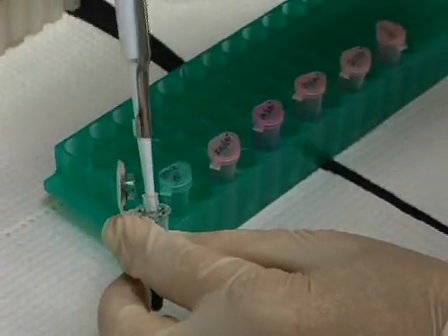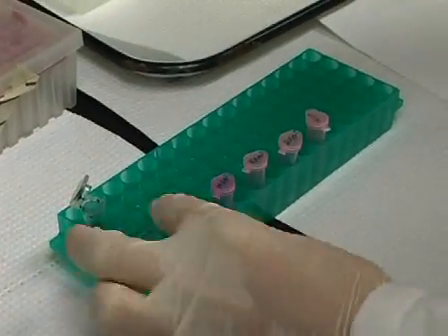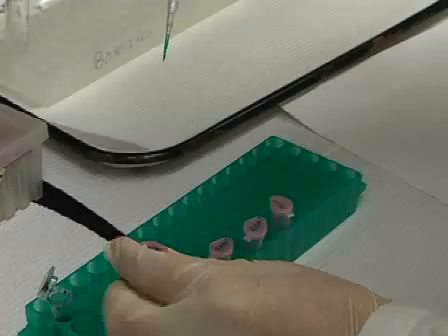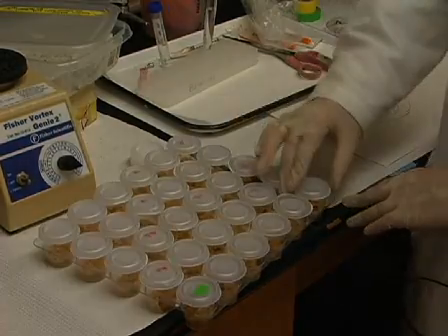Include green food coloring dye to a 4% concentration by volume. In order to determine the lethal viral concentration, the dilutions should give a range of mortality between 1 to 99%. Preliminary bioassays may be required to determine an appropriate range of virus concentrations.